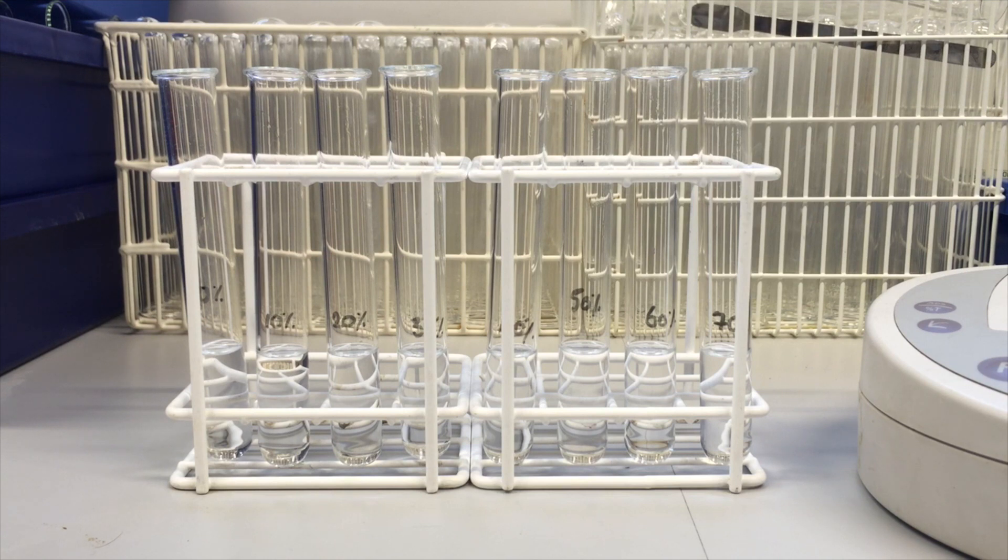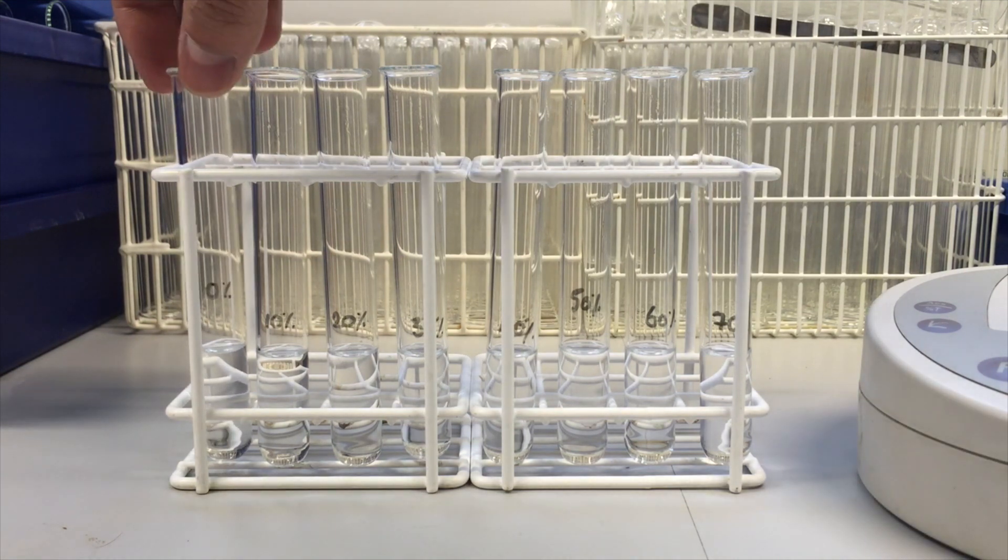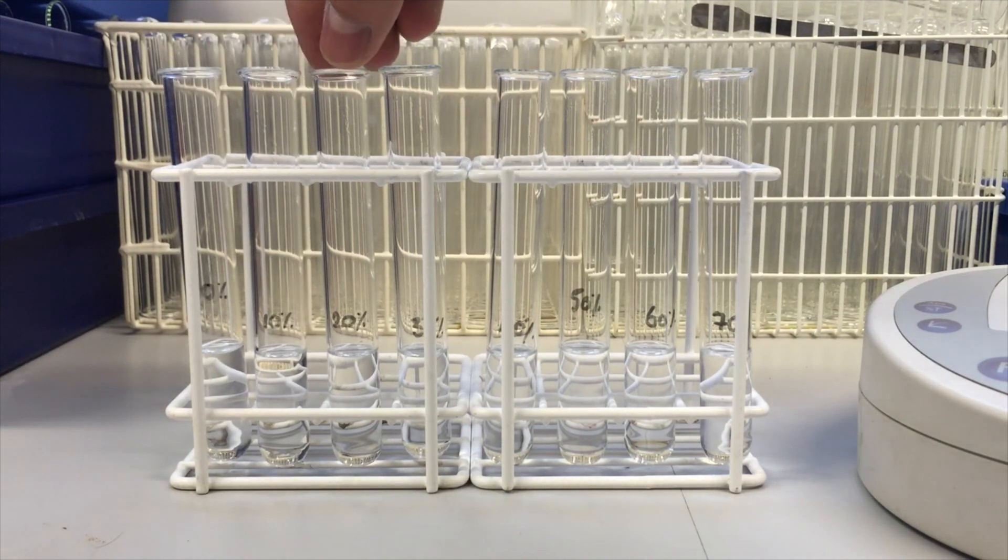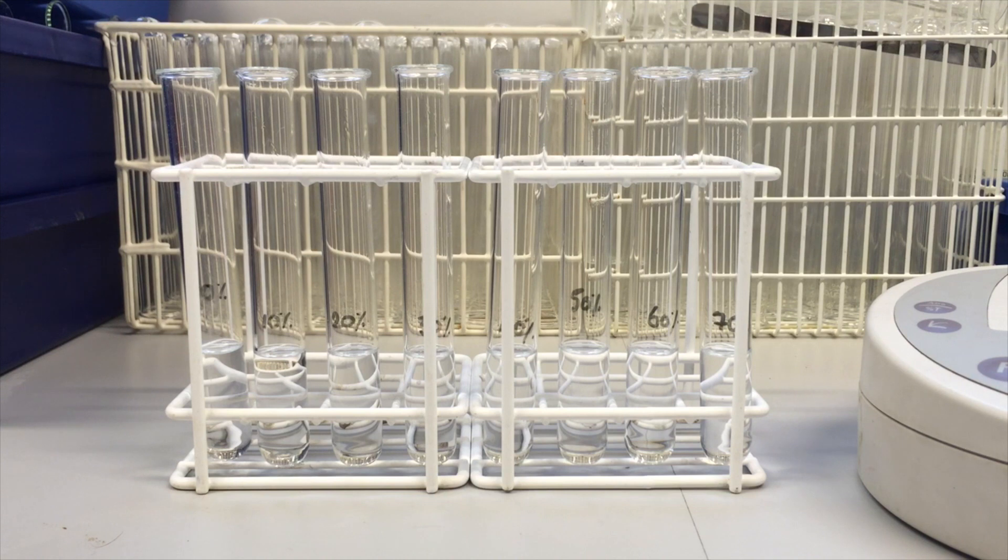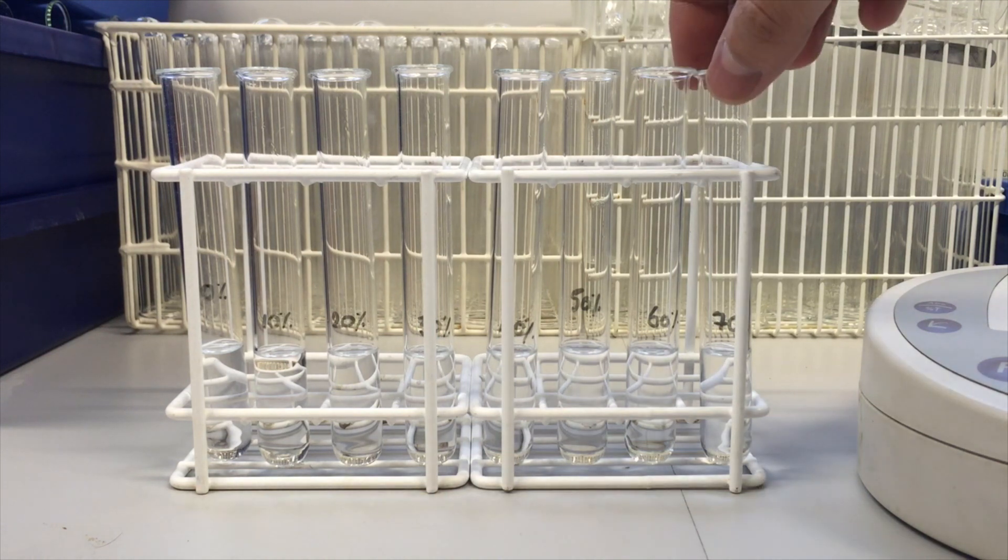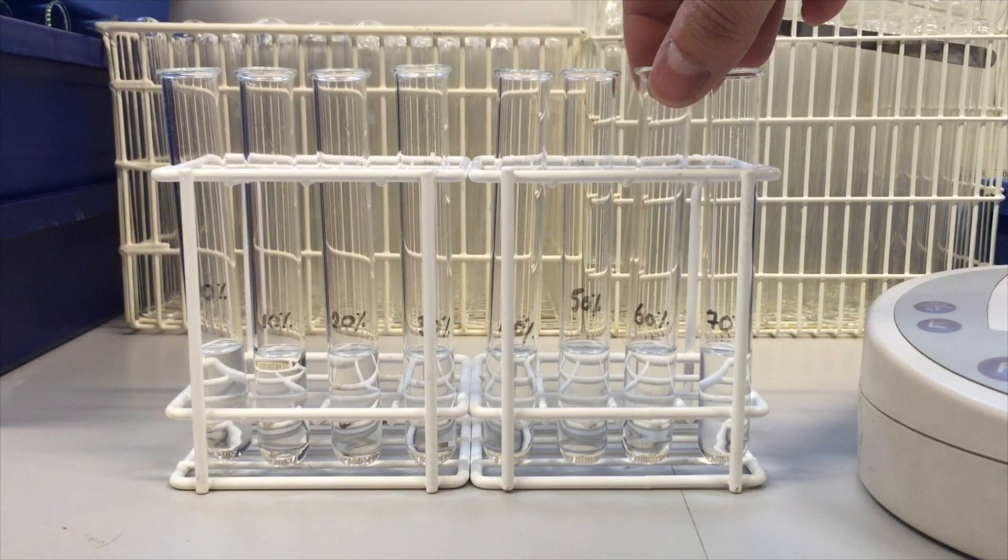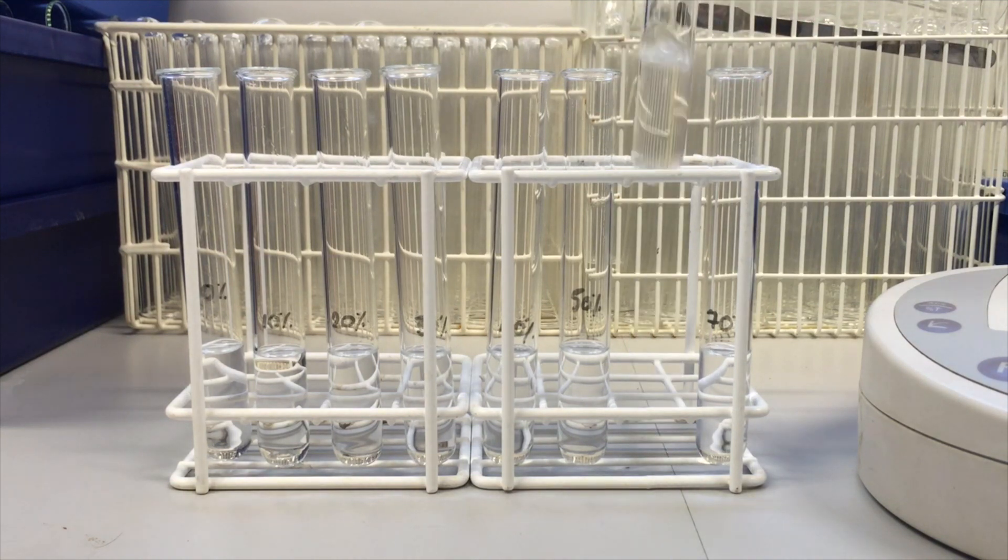We're going to be looking at the effect that different ethanol concentrations will have on the fluidity, on the structure of the membrane, and the way we're going to be doing that is... Well, I'll explain that next.